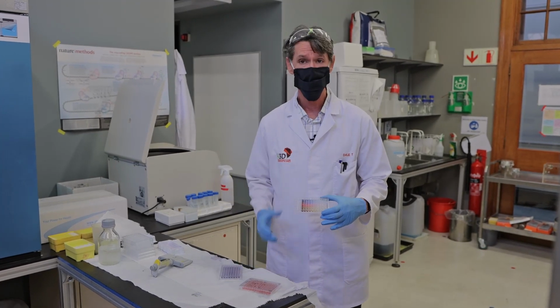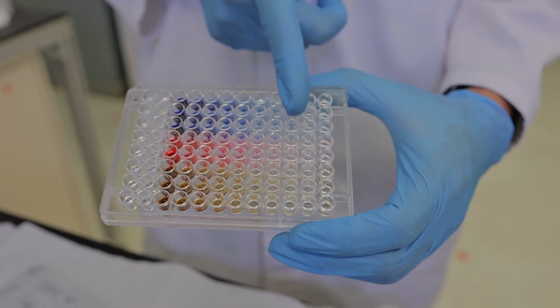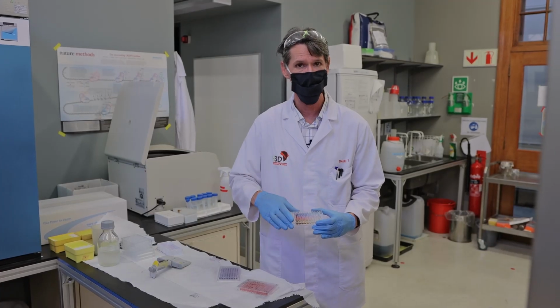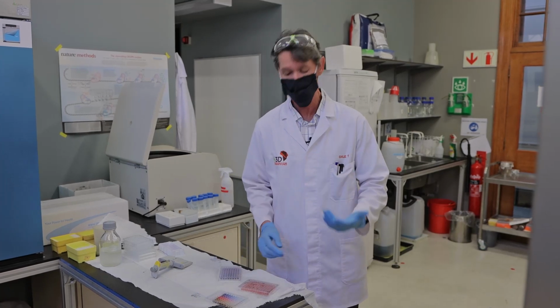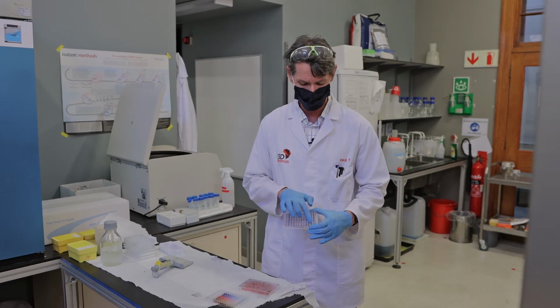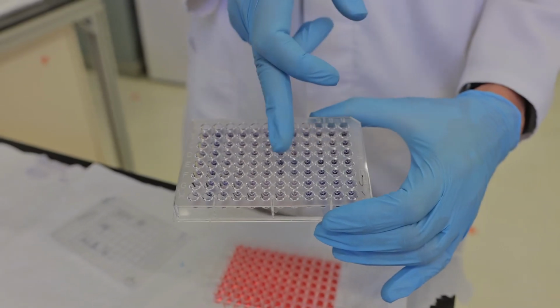So what we have in this plate are 3 different drugs, each starting at a very high concentration and diluted down to a very low concentration. So we get an idea of where activity against the parasite may lie. But of course, you can't see anything until you develop the plate, and we get a result like that. And what we're interested in is exactly where the color changes. The further to the left it is, the more active the compound is.